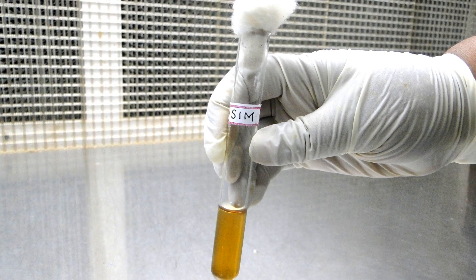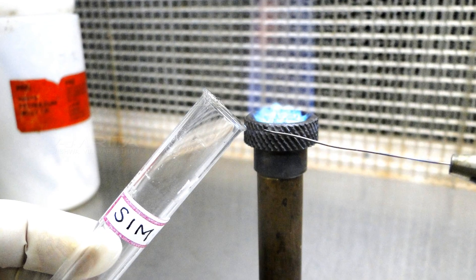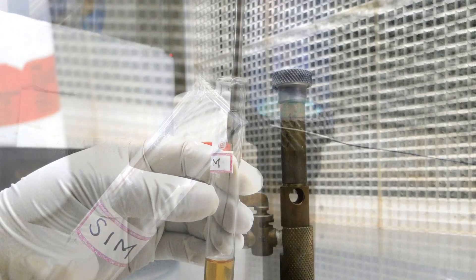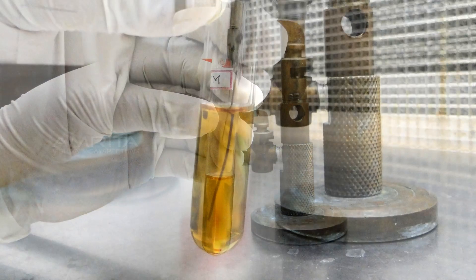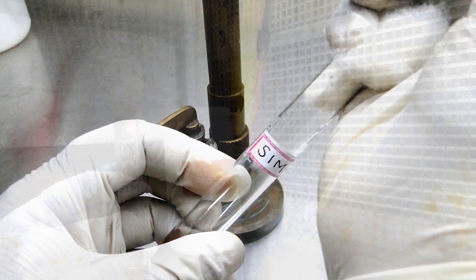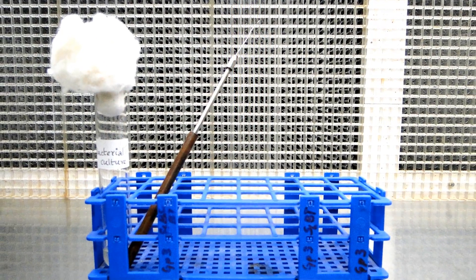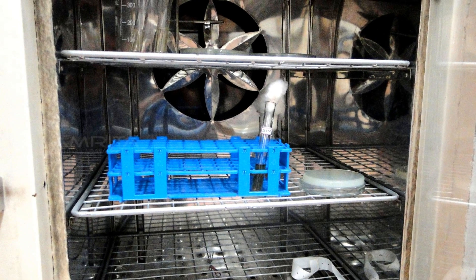Now take the SIM medium and remove the cotton plug. Flame the mouth of the tube containing the medium. With the inoculation needle, stab the medium vertically — take care not to touch the bottom of the tube. Flame the mouth of the tube and close it. Flame the inoculation needle again and keep it back on the rack. Incubate the tubes at 37 degrees Celsius for 24 hours.